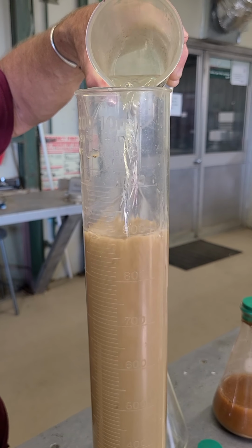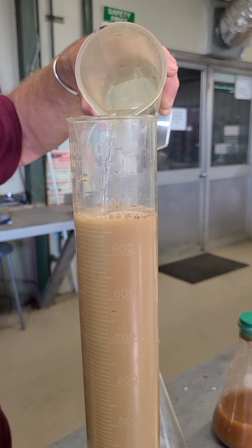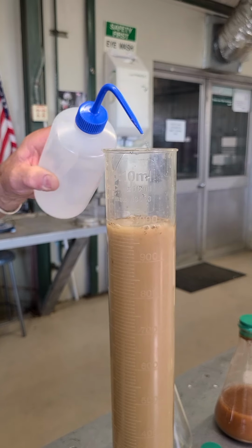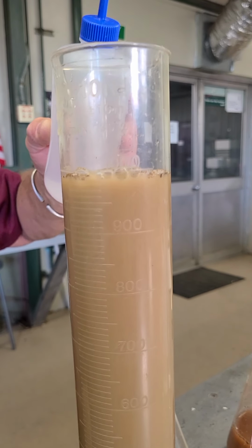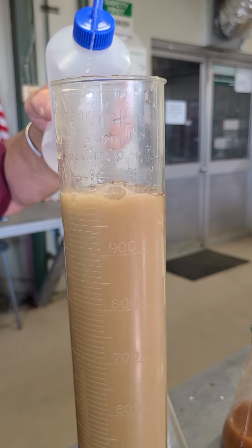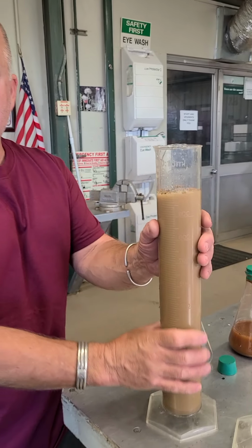So I'm getting kind of close now. I'll slow it down. See, if I go over the top, I've kind of messed this thing up. So you're actually better just to be real careful, and then stop there, and then I'll use the squirt bottle, and I can get anything on the edges. And you can see that I'm not quite there yet. All right, I think I'm right on that mark now. So there we go. There's one sample prepared.